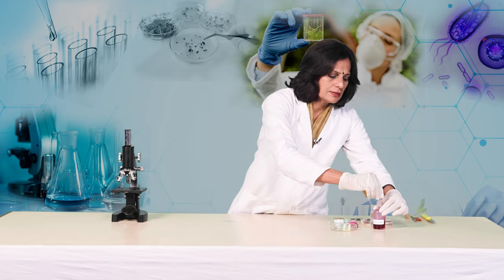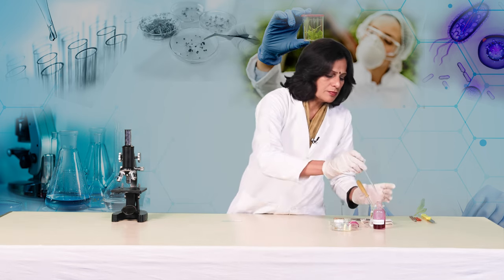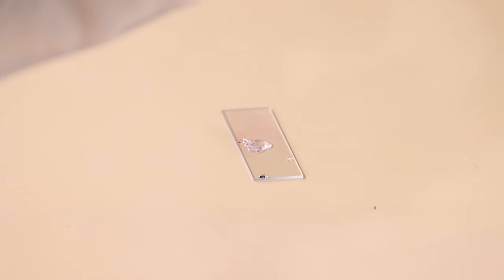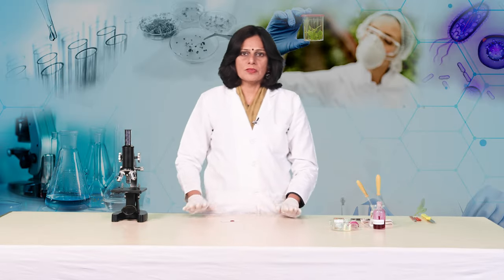We have to use the stain, which is aceto carmine. We will put two drops of this aceto carmine stain onto this peel. This was the aceto carmine stain.